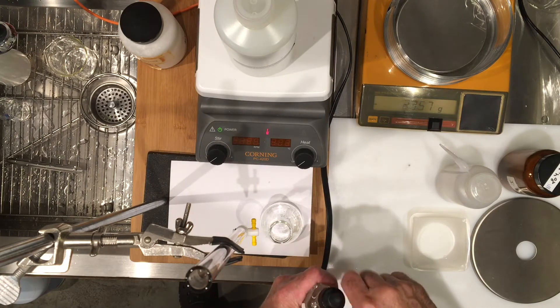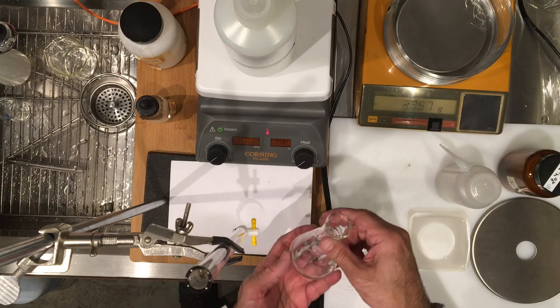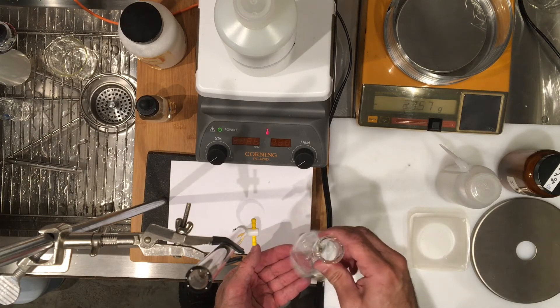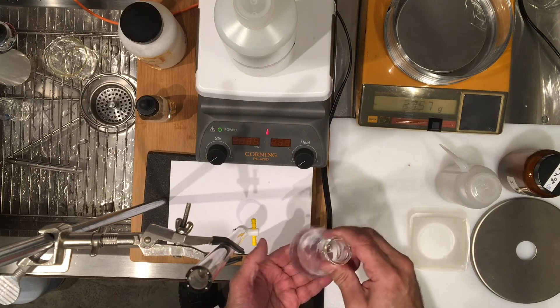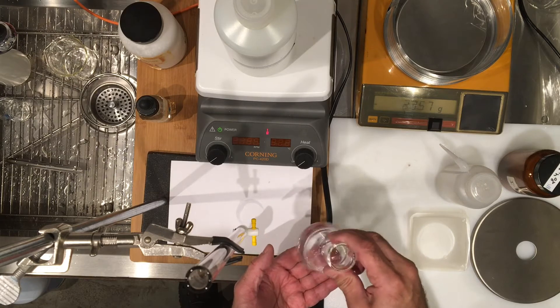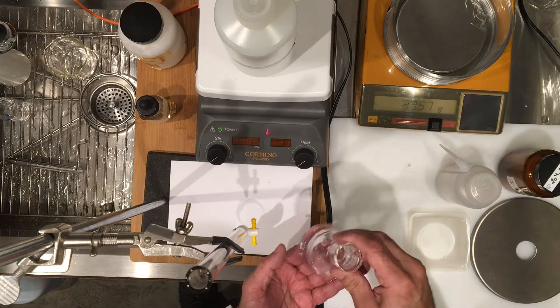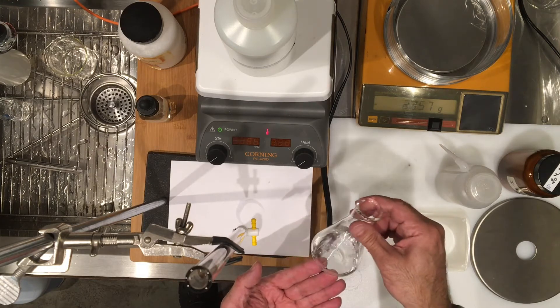It's colorless in the presence of a solution that's more acidic, and the color will change to a slight pink which indicates excess sodium hydroxide, which is roughly around the pH of 8.5 to 9, but it would be marking the end point of my titration.